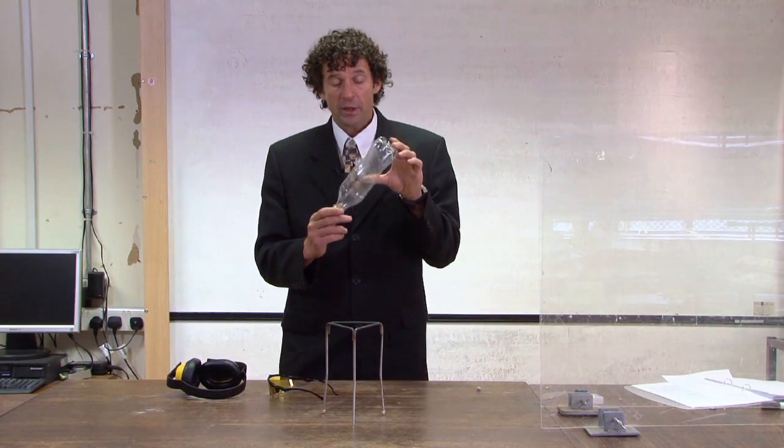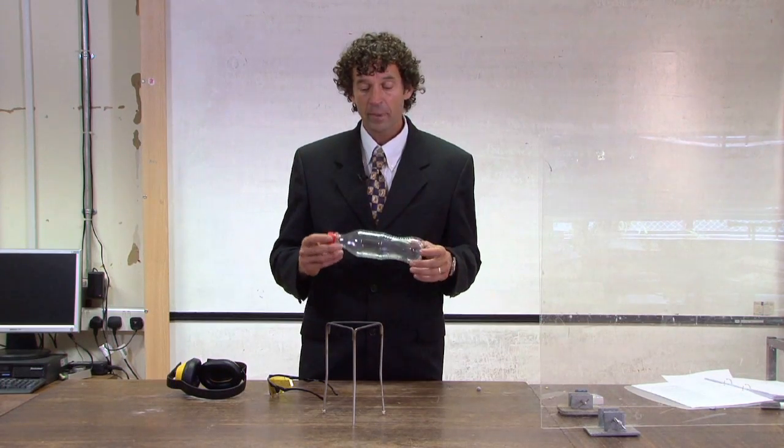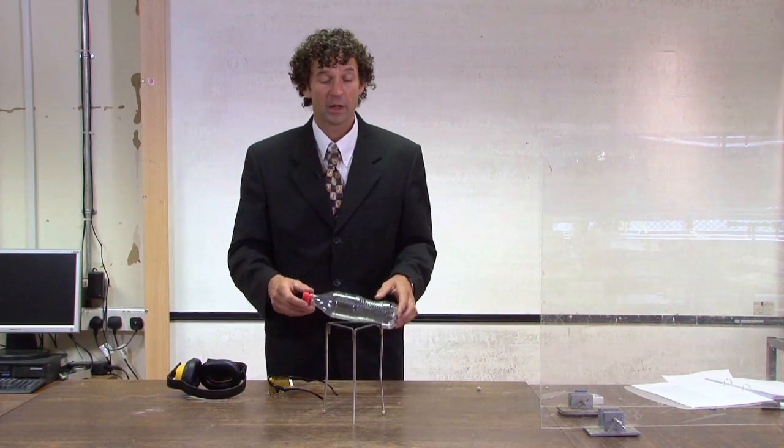It needs to be the ratio of two parts hydrogen to one part oxygen, and have your bottles made up beforehand.